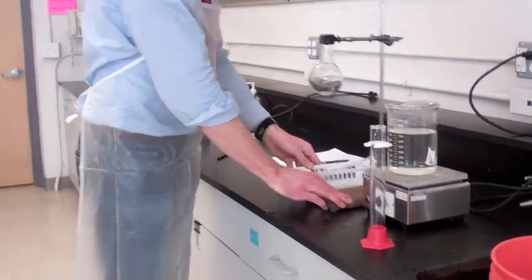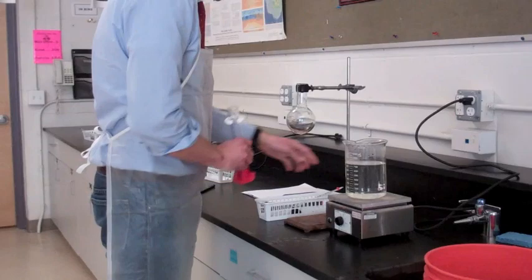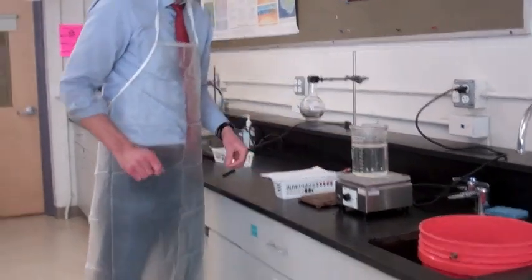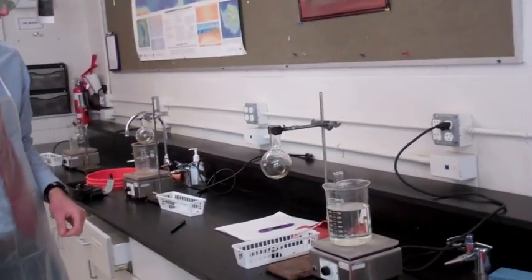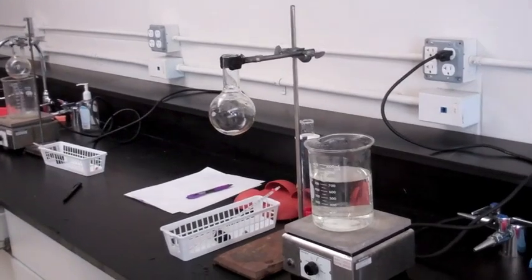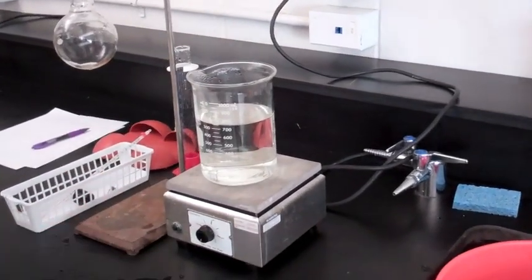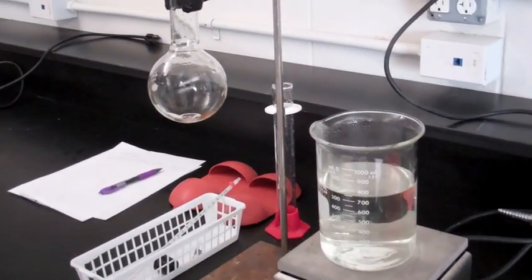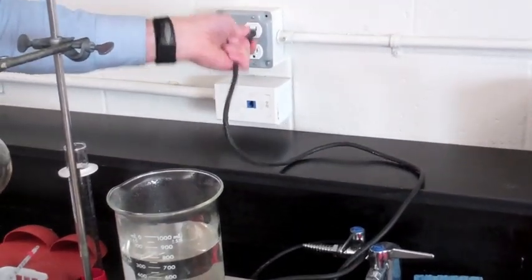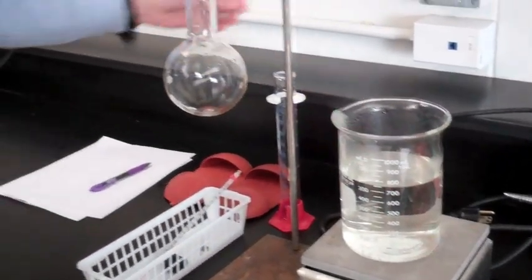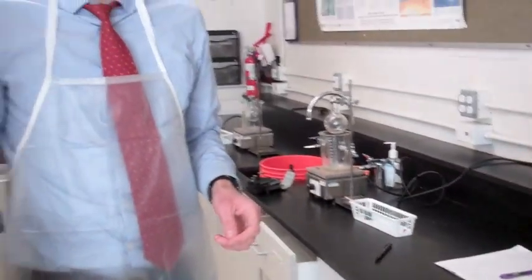All right. Now we've got all our data. We can make sure everything looks clean and neat like it did when we started. And the hot plate is off so I'm not worried about safety. Maybe we should even unplug it. Thank you.